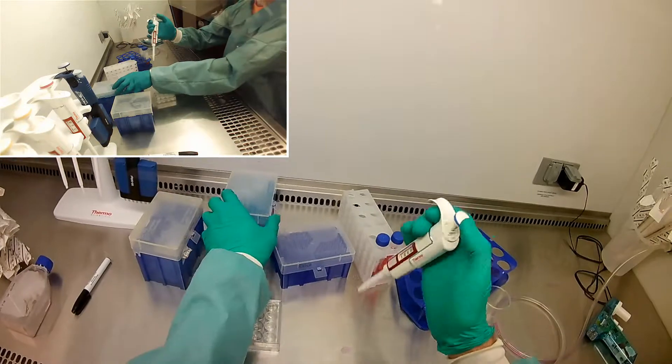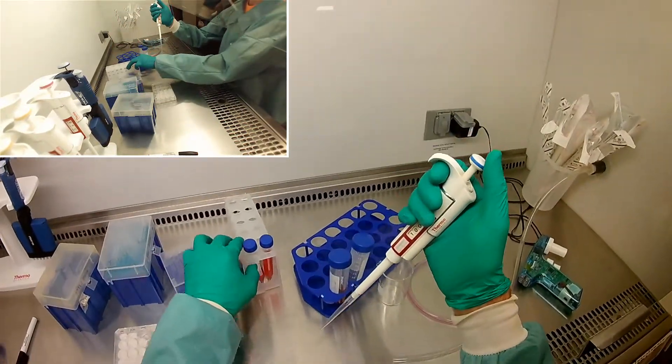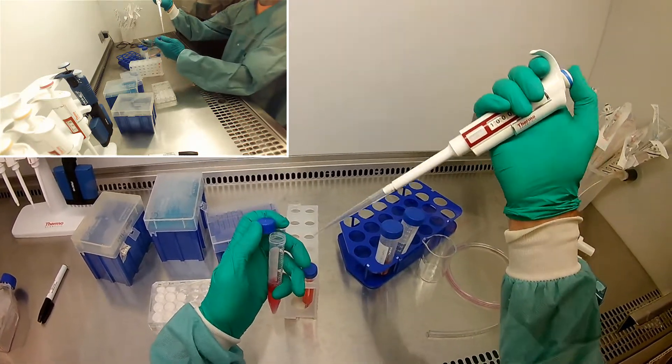And now I'm going to get one mil. It's pretty convenient how one mil, the suspension came out to be perfectly, I need one mil.